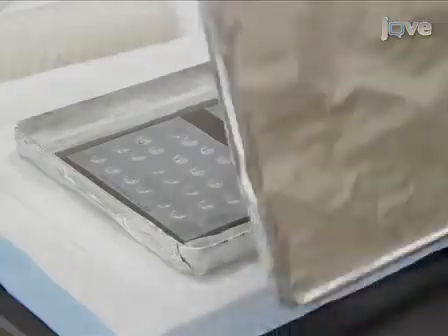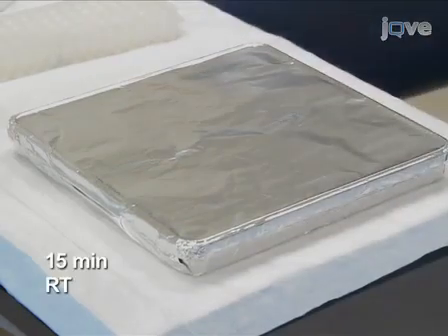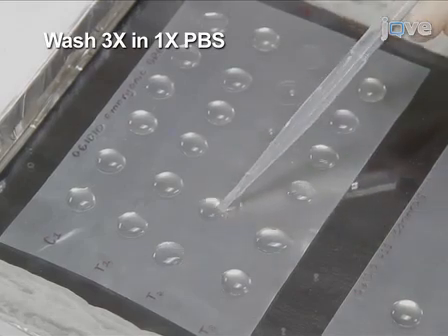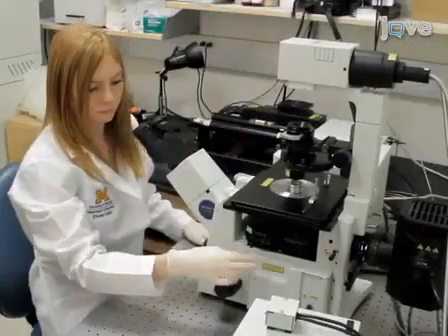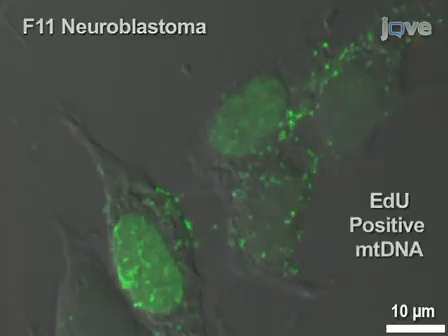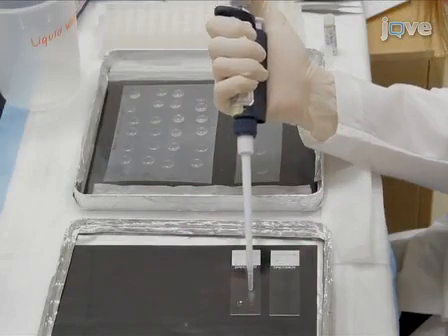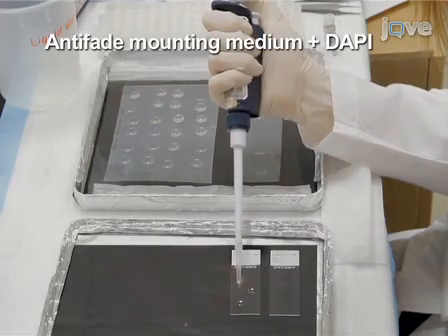Incubate the cover slips with the tyramide reaction for 15 minutes at room temperature. Wash 3 times with 1x PBS, incubating in the final wash for 30 to 60 minutes as before. Under the microscope, check for mtDNA labeling. Mount successfully stained neurons on glass slides with an anti-fade mounting medium containing DAPI.